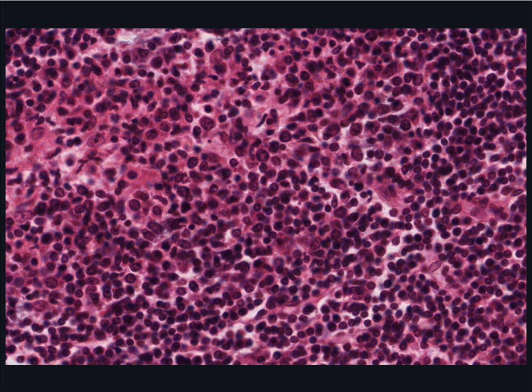More rarely, you can see nuclei as large as those of the dendritic cells, but darker and with a discrete rim of basophilic cytoplasm. But you really have to look very, very carefully. The cytoplasm will have a sharp outer perimeter. These cells are lymphoblasts. The edges of the cells are visible because they don't have the cytoplasmic arms sticking out.